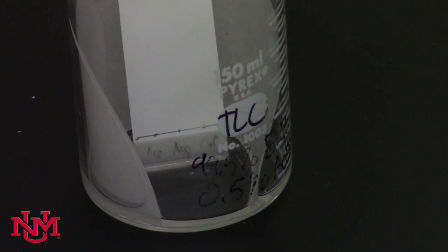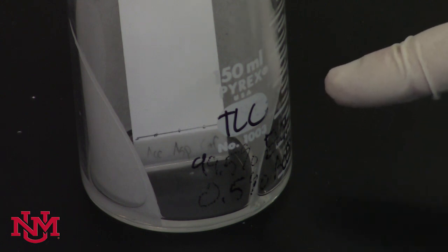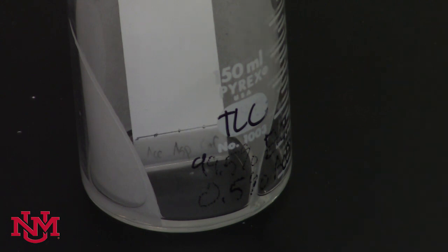This is called the solvent front. The area where you marked the spots is called the origin. You're looking for how far certain spots move up the plate relative to one another, but you have to have a finish line. When the solvent front reaches the finish line, that's when you'll remove the TLC plate from the chamber.